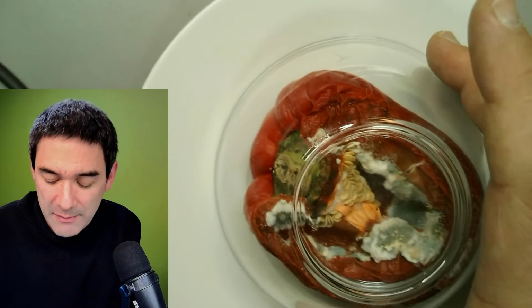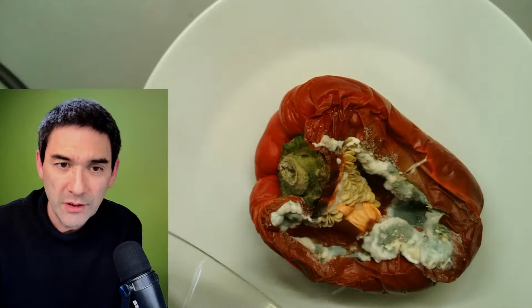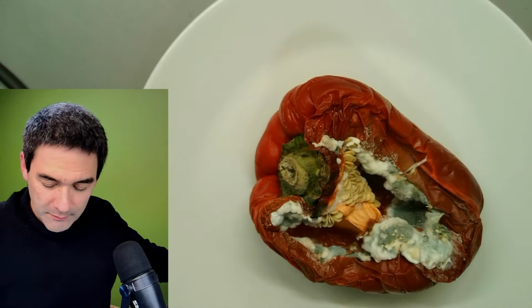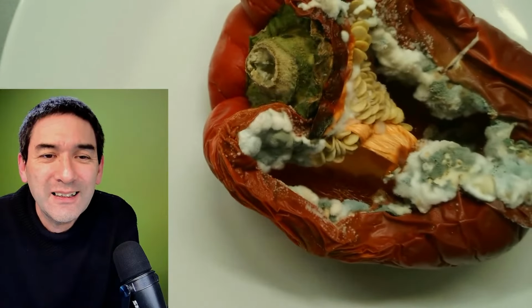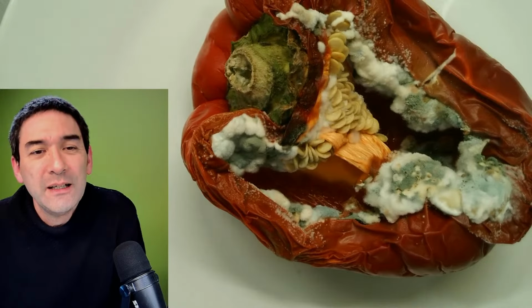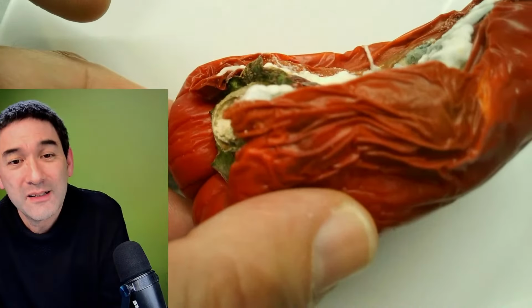This here is, I made a video in my other channel, which I just talked about: is it okay to cut away the moldy part and then eat the rest? Isn't this really, I mean, to a certain extent, it does look kind of interesting, right? I've got to wash my hands a little bit, yeah.